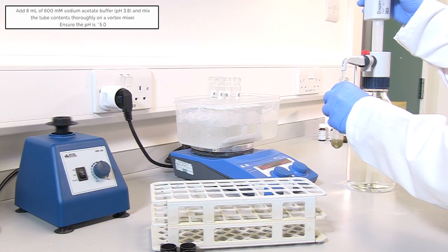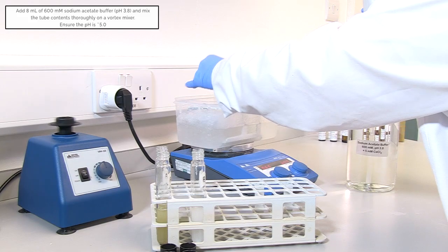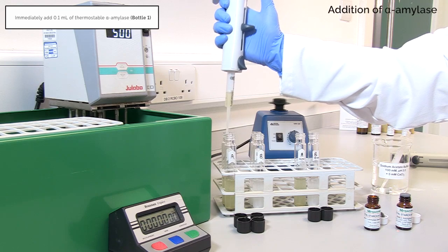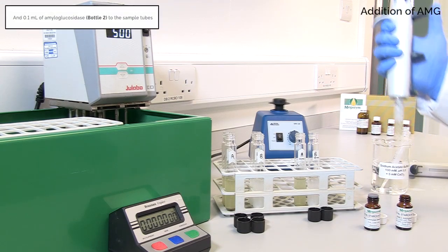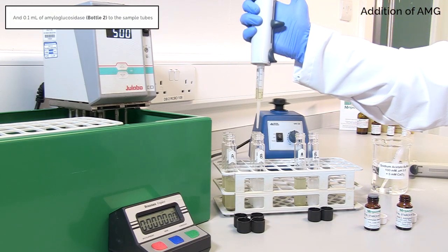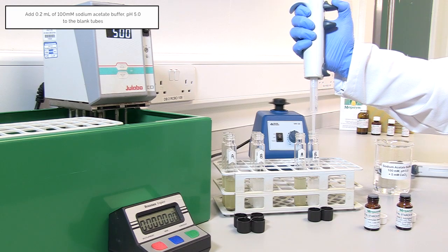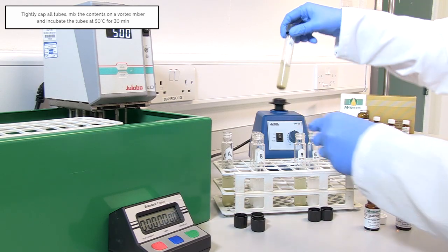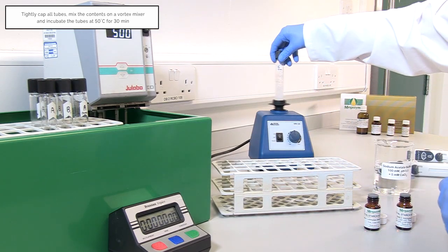Add 8 millilitres of 600 millimolar sodium acetate buffer pH 3.8 and mix the tube contents thoroughly on a vortex mixer. Ensure the pH is approximately 5. Immediately add 0.1 millilitres of thermostable alpha amylase and 0.1 millilitres of amyloglucosidase to the sample tubes. Add 0.2 millilitres of 100 millimolar sodium acetate buffer pH 5 to the blank tubes. Tightly cap all tubes, mix the contents on a vortex mixer and incubate the tubes at 50 degrees Celsius for 30 minutes.